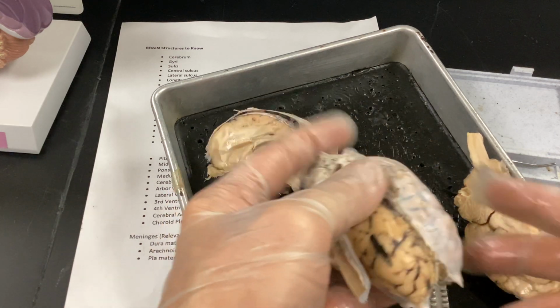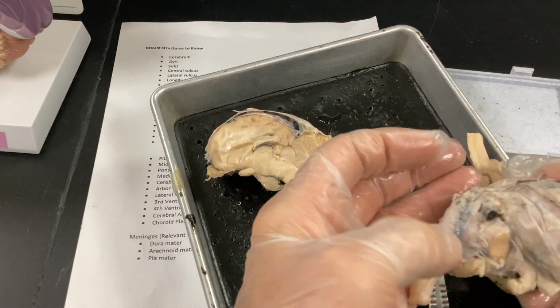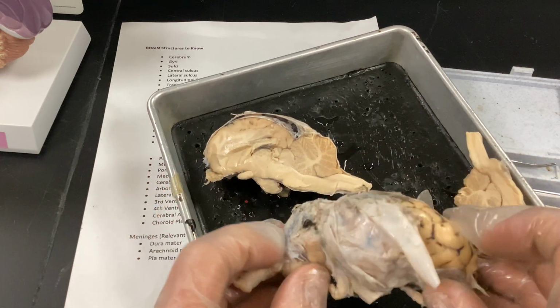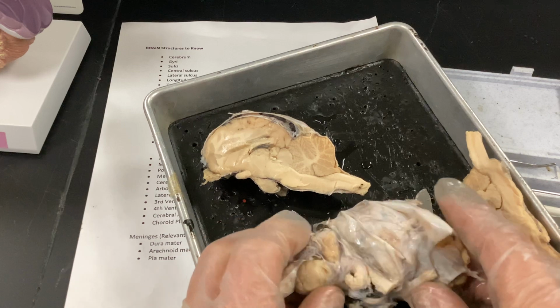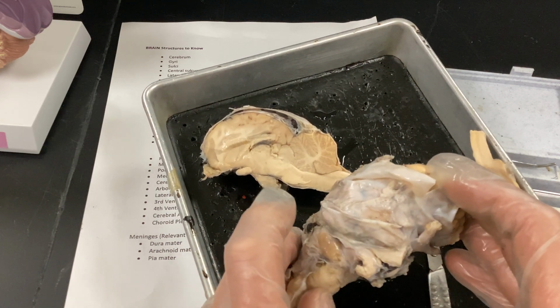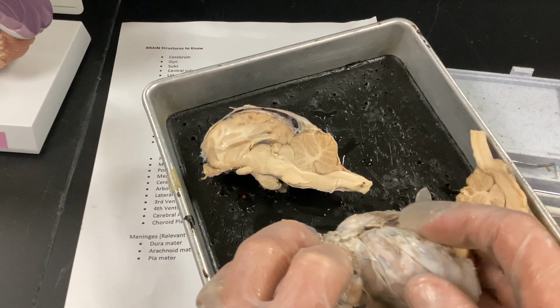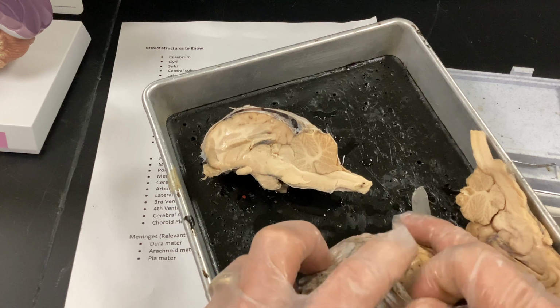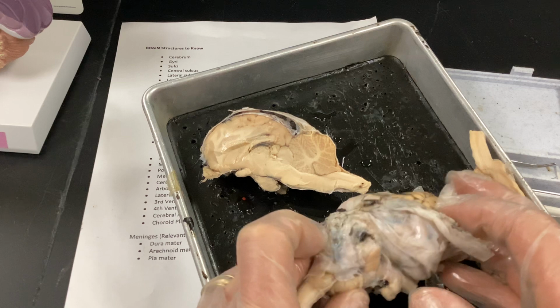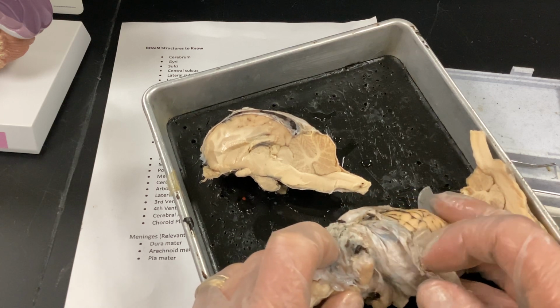All right, so this is frontal or anterior to posterior. So when I cut this all off in here, you're going to actually see the cerebellum. Remember, that has 2 L's, so it's going to be for balance. Your cerebellum also has information coming from the brain through the pons here, sends it back to the cerebellum to fine-tune all of your fine motor functions. If you're playing the violin or something really, really delicate, it will process that, and I'll show you on the brain.